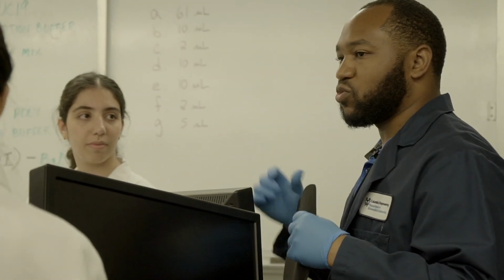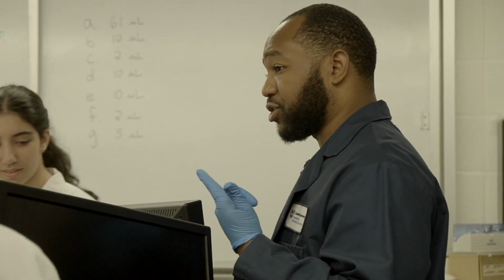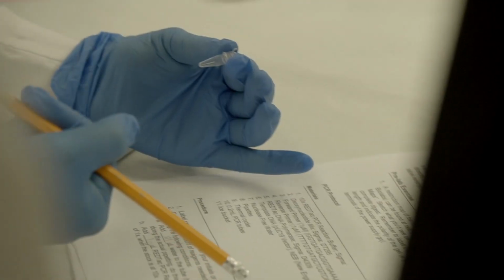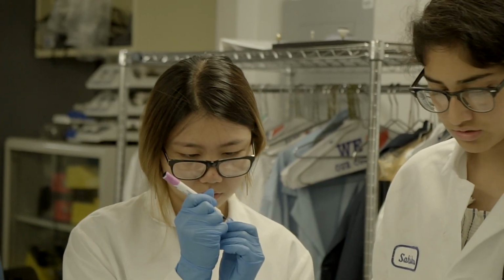If you have not done so already, please choose some number or abbreviation so that we know which tube is your group's. Really good. You're each going to have 2, one for PCR and one for restriction digest. Whatever you choose, make sure you put it on your protocol so we can see exactly. You need to be able to distinguish PCR from restriction digest and your group.